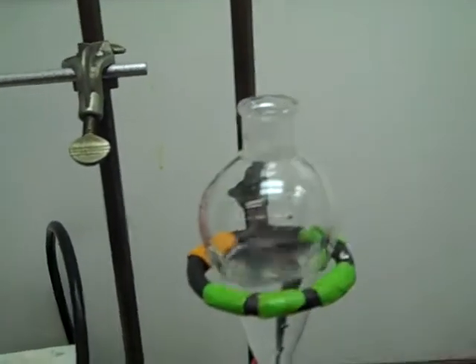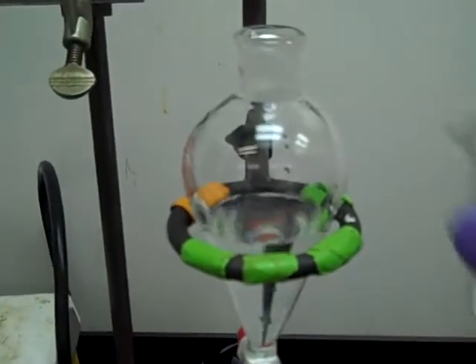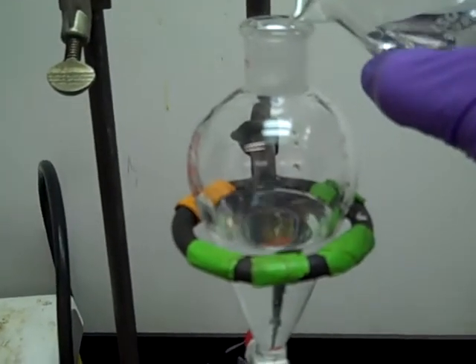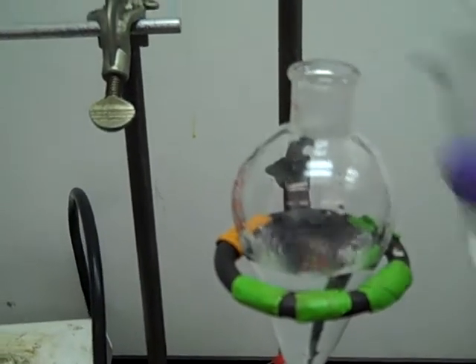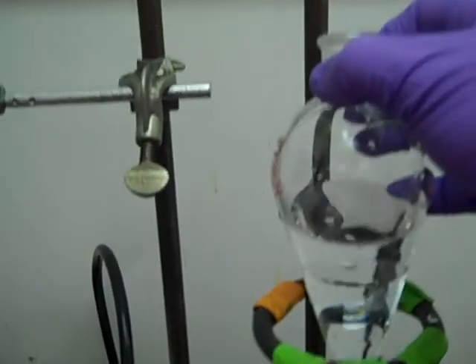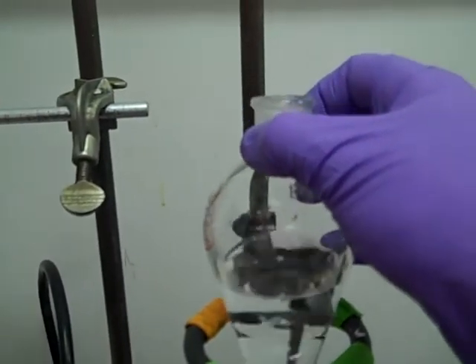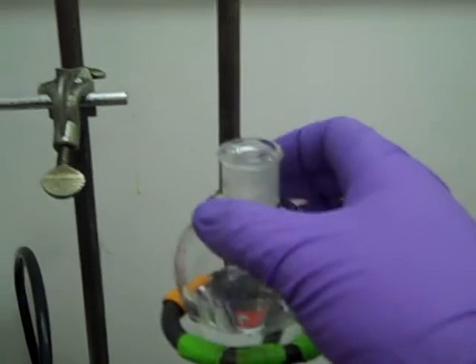If you're ever in question, then you can add a little bit more water to see which layer it goes to. So if I didn't know which layer water was, if I had a little bit more water, I can see which layer gets bigger. And in this case, we would have seen that the top layer got bigger, which means water is less dense than dichloromethane.